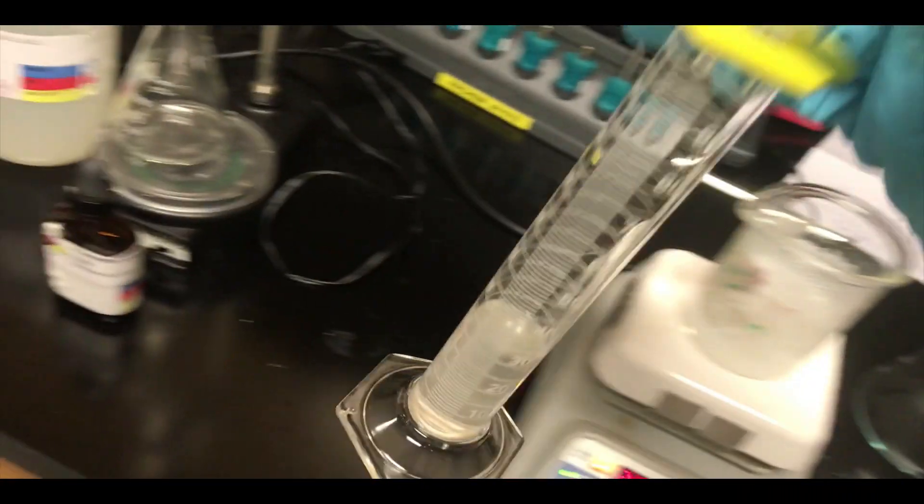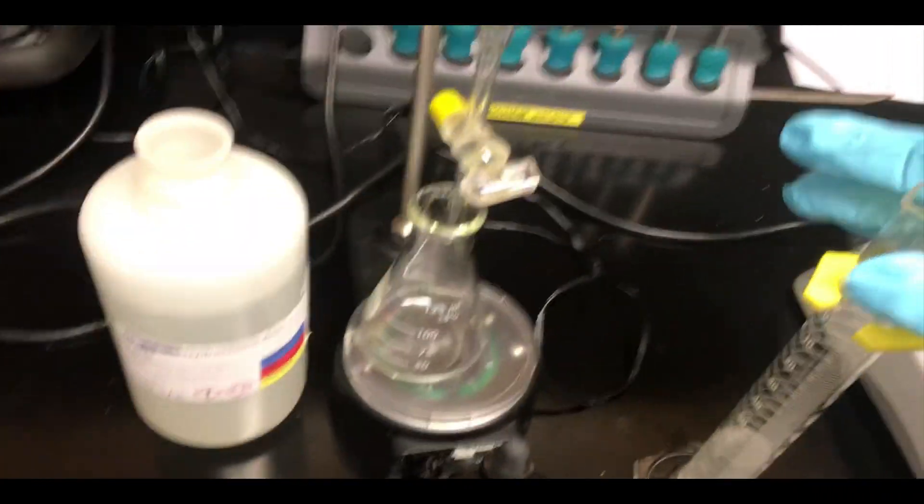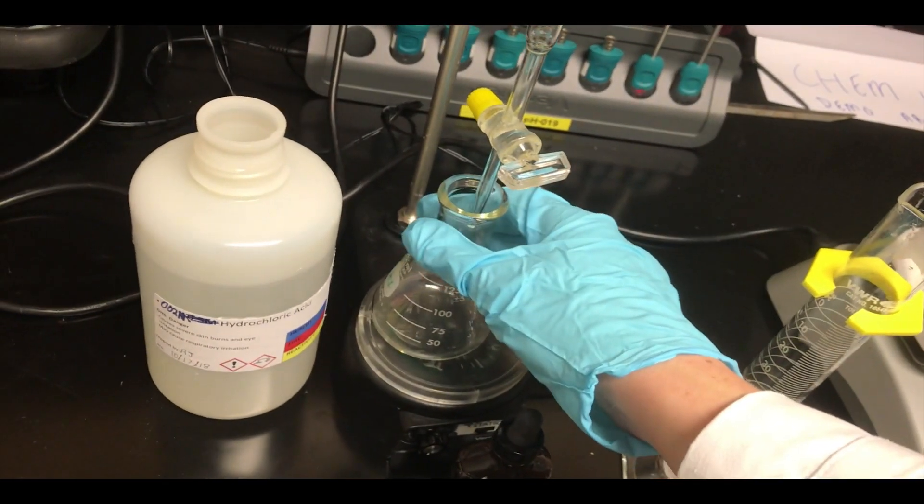And you can see it getting a bit cloudy, and this is because of cooling of that solution. So here again, you want to work as efficiently as you can.